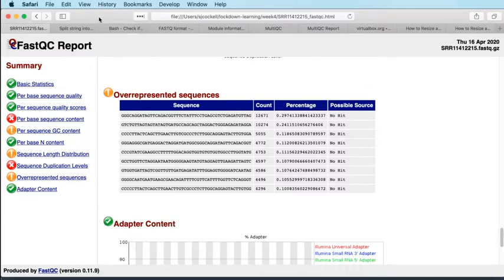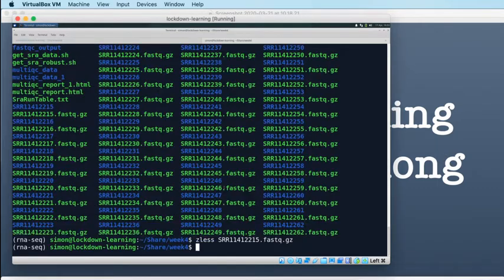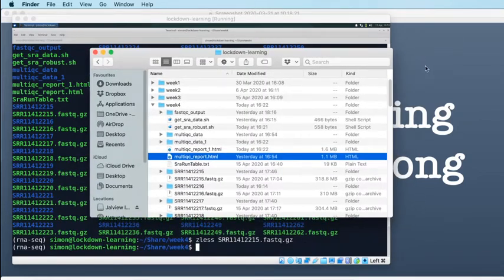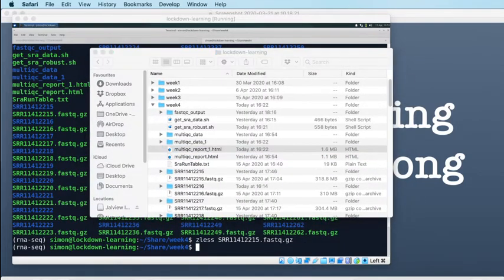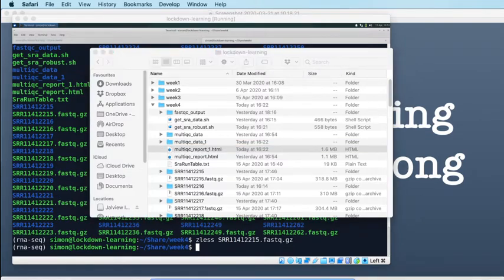Okay, so then the final thing that I want to do today is take a very quick look at the MultiQC report. So the MultiQC is effectively replicating what FastQC is doing, but it's showing you the reports for all of your files in one go. So if I grab my Finder window up that I had yesterday, so here's Finder, and here's my new MultiQC report that we produced at the beginning, or about half an hour ago, I guess now. So I dragged that into my browser, and we'll take a look at that.